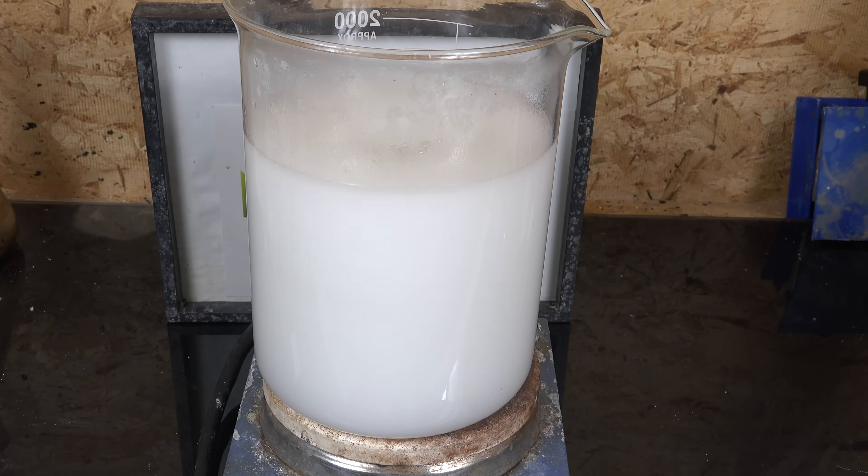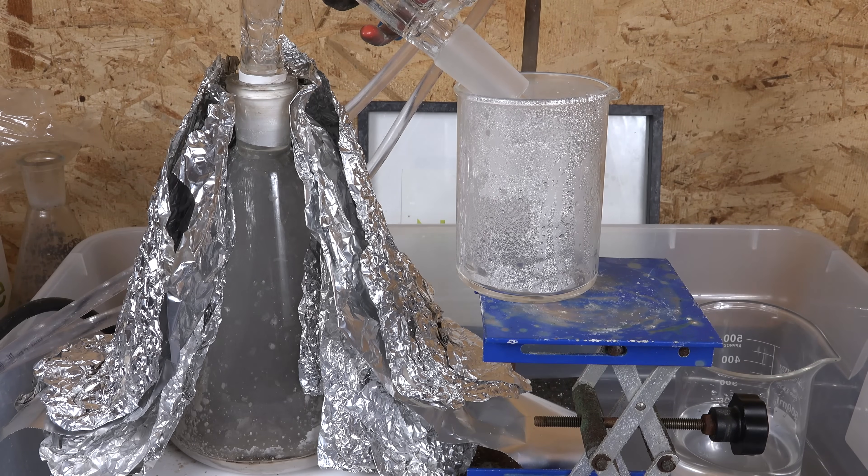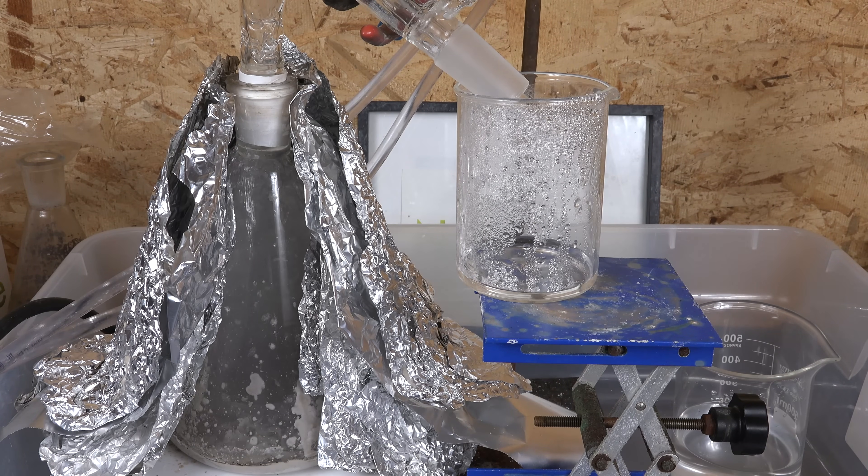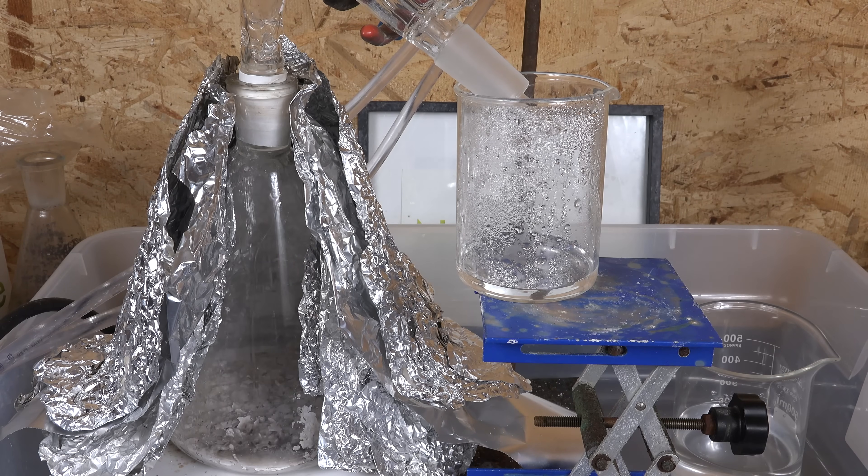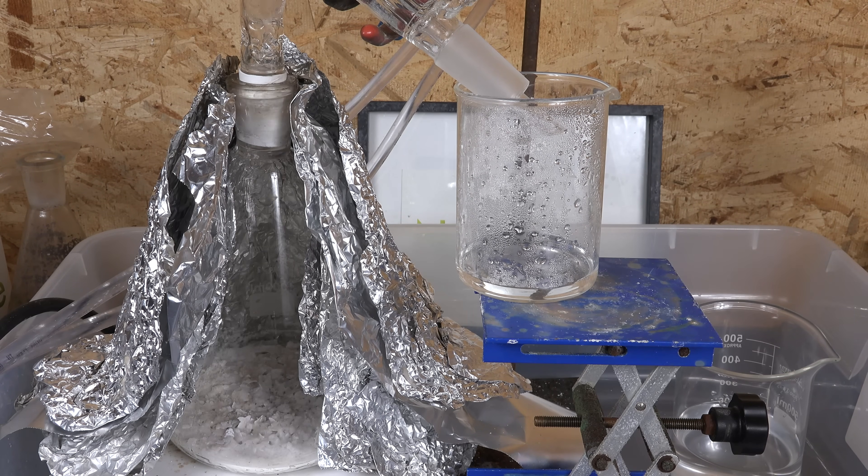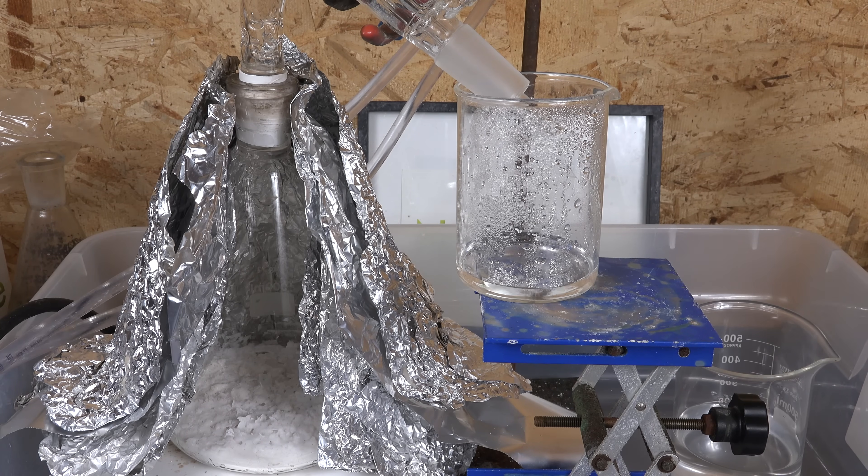This precipitation contains some magnesium oxalate, but actually it's mostly oxalic acid cooling and crystallizing back out. Anyway, the small amount of sulfuric acid that was produced, as well as dissolved oxalic acid gave an acid indication to pH testing. So the bias was confirmed and those chemists discovered this method successful.